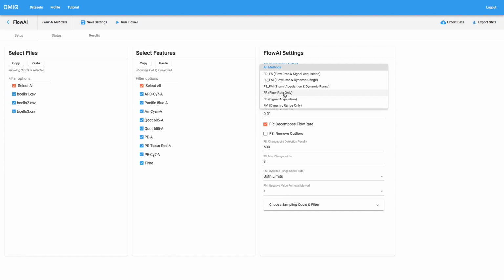in the FCS file per unit time, and it tries to remove anomalies, either surges or drops in the flow rate. What signal acquisition looks at is it actually looks at the parameters that you've chosen over time, and it finds anomalies in the signal during that time. And it does a lot of other fancy logic and ultimately finds regions of the data across all channels that are smooth and don't have anomalies in them. And then the last option, dynamic range, looks at the dynamic range of the signals in each channel, and it removes positive and negative outliers. So extreme data values, it looks to remove those.